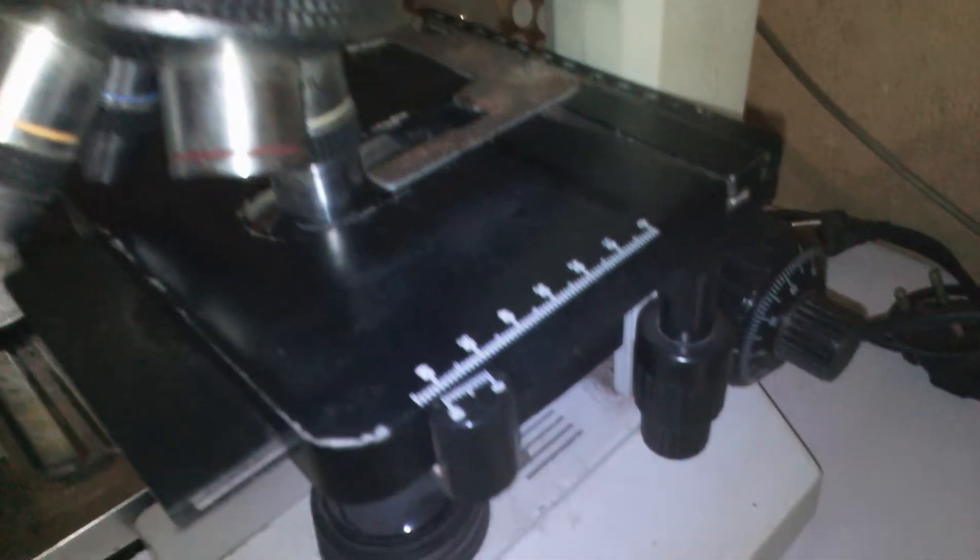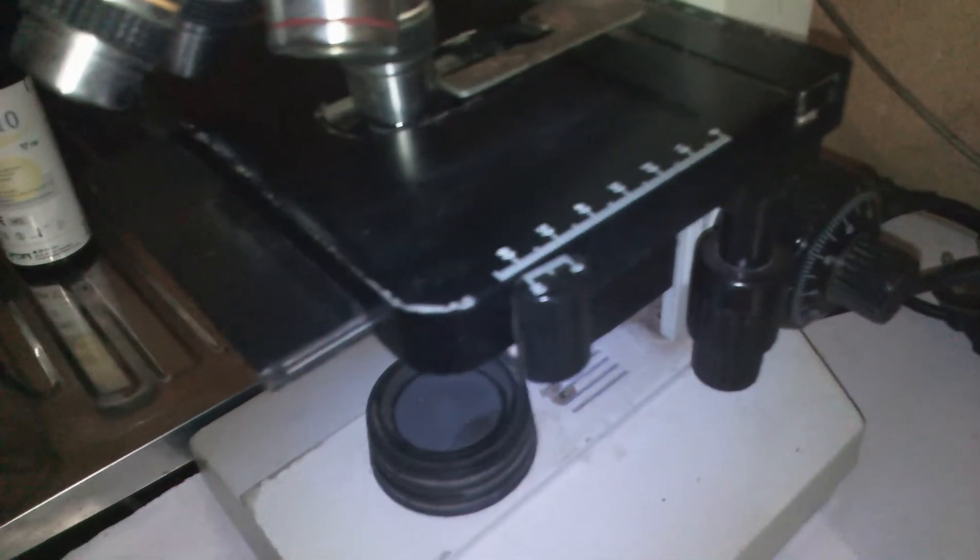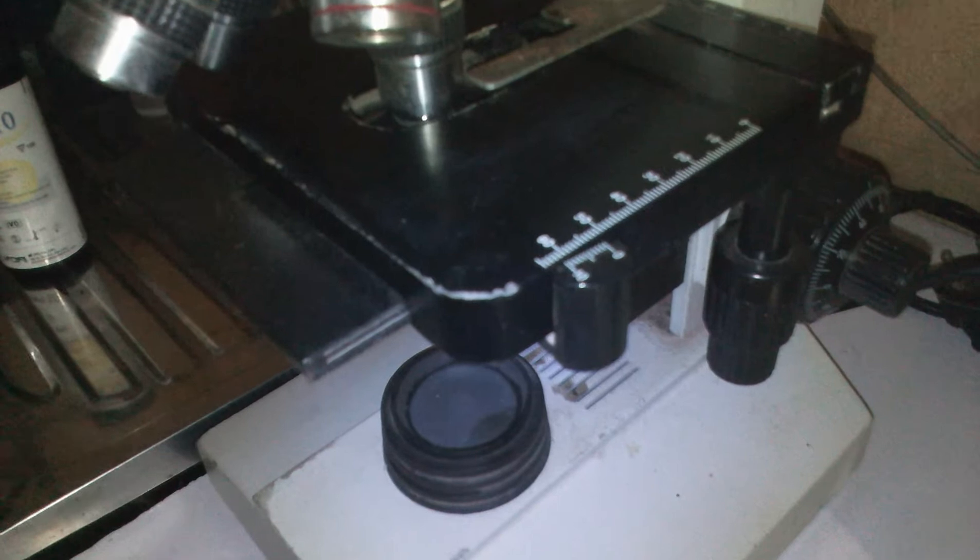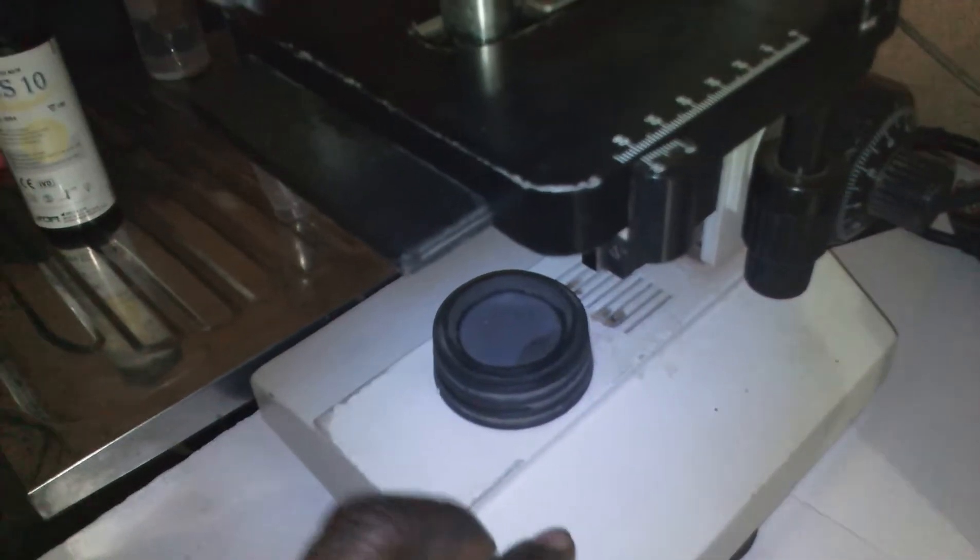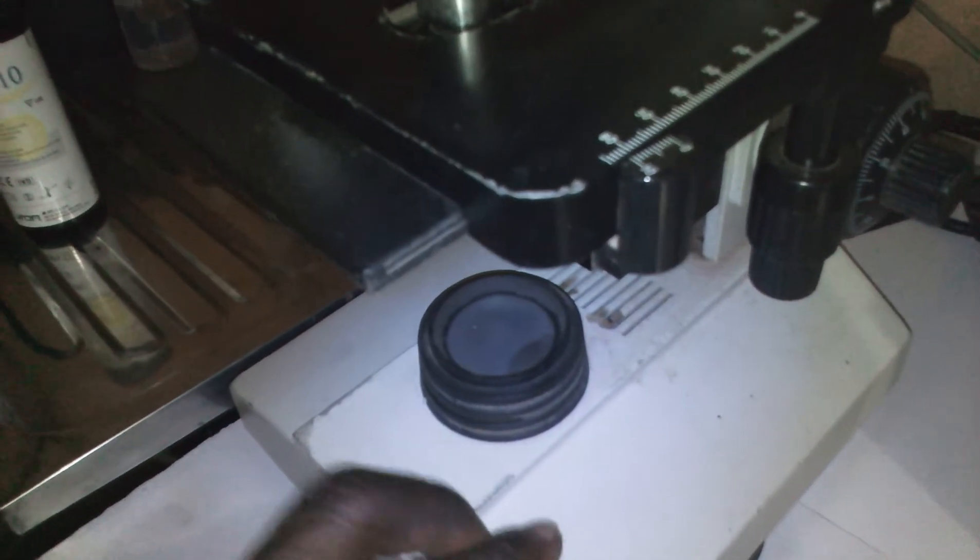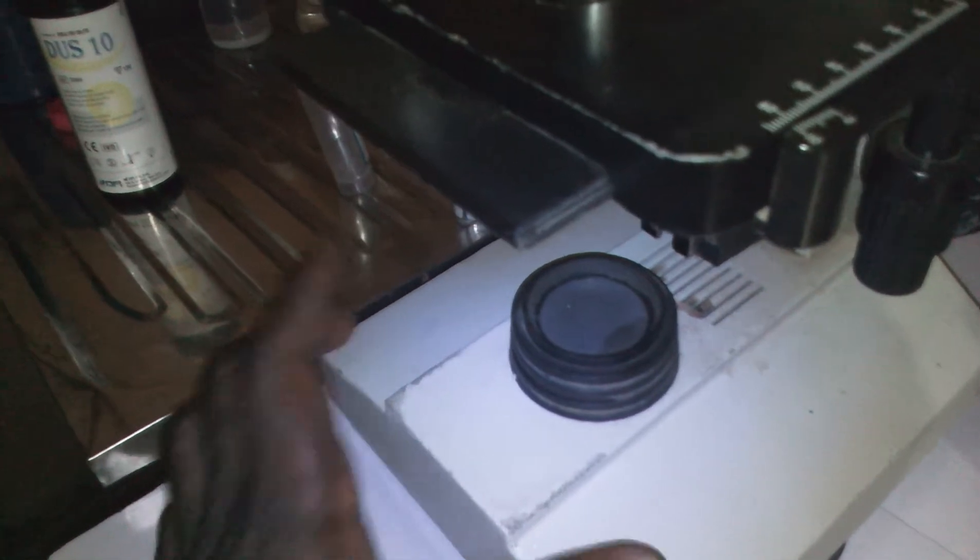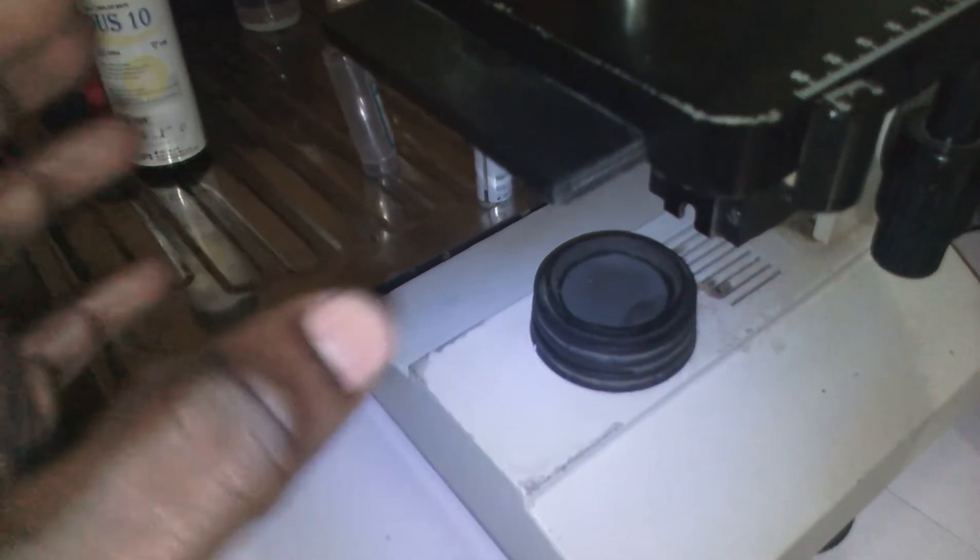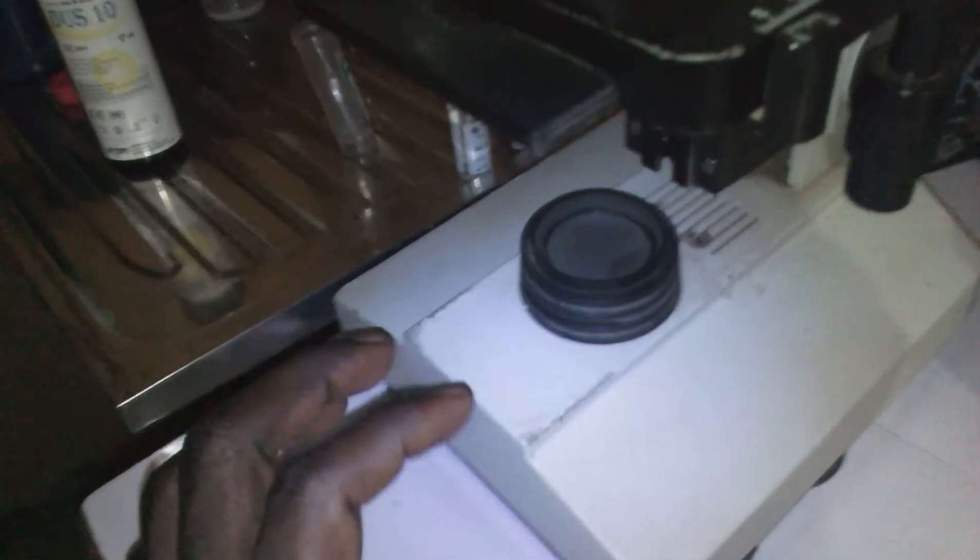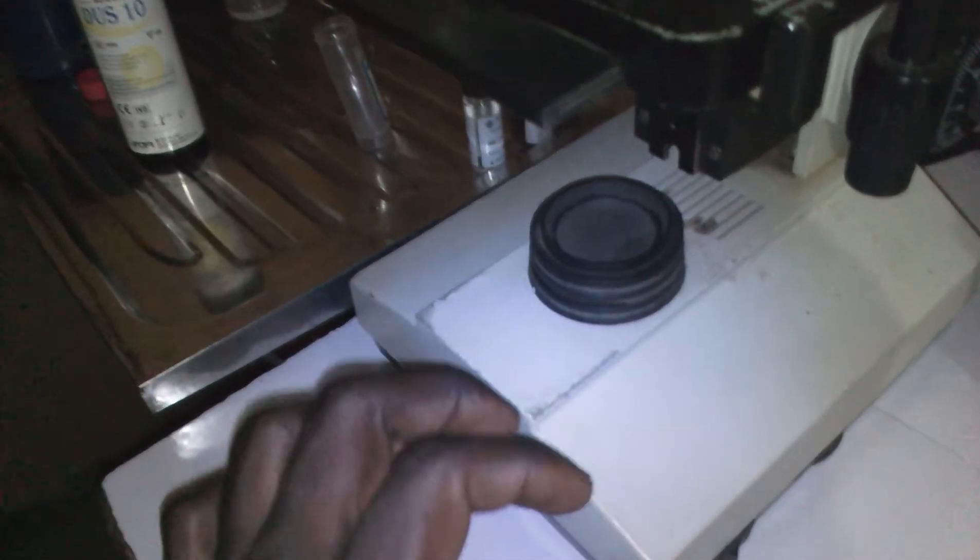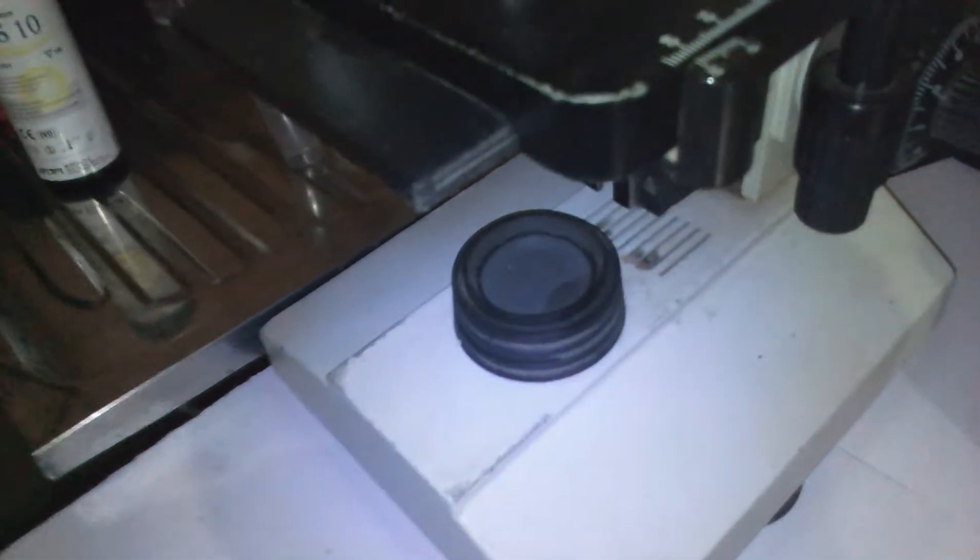This is your base. The base has all the other components, both the lenses and the light regulation. This is our cable to connect it to the light source here. We have plugged it in.